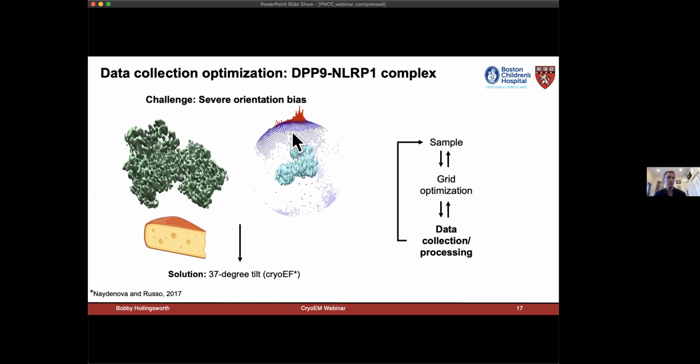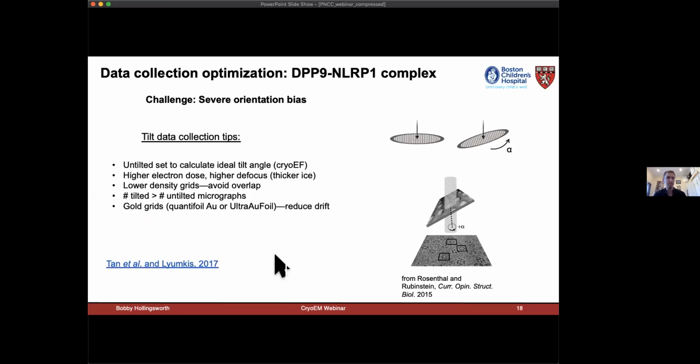And so what we did was pipe in the angle distribution file generated from RELION refinement into the program called cryoEF, and here's the citation for that. And cryoEF recommended, based on this initial angle distribution and orientation bias, that we tilt the stage at 37 degrees, and that ended up working perfectly for us. And that orientation bias was reproducible across different data sets, so we didn't think it was attributable to ice thickness or anything. So for us, that particular tilt angle worked well.